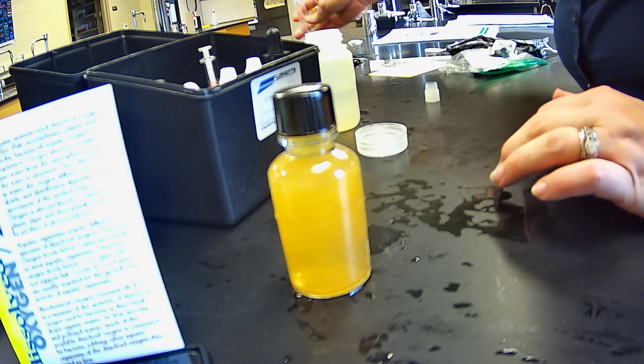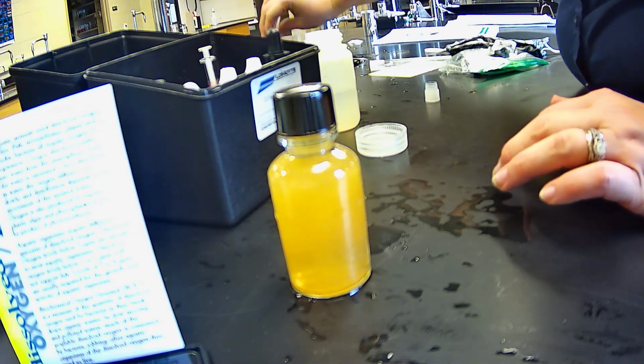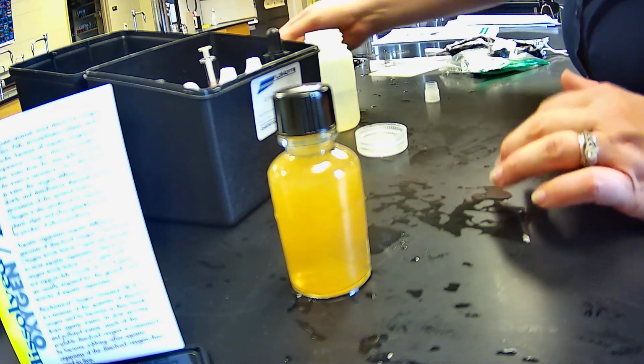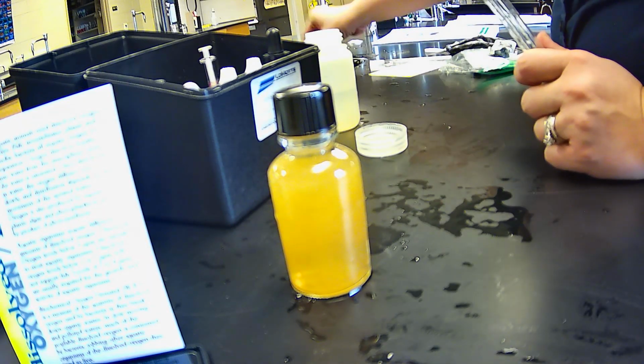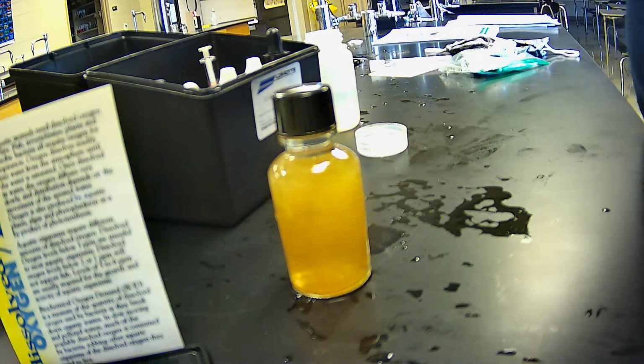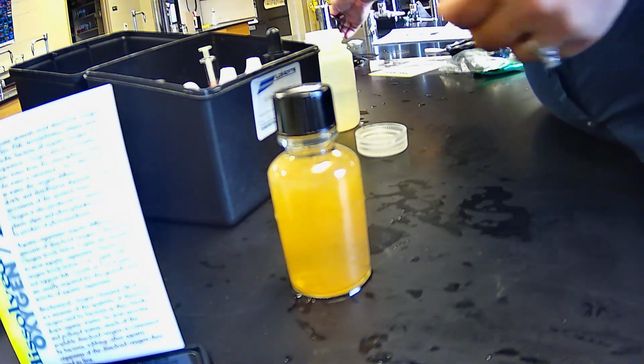If you think those samples were darker, timing really is important for water quality testing, because the longer you leave something, sometimes the darker it gets or the lighter it gets. So if it says wait 5 minutes, you should try to be as accurate as possible. You don't want to just wait around too long for any of this, okay?